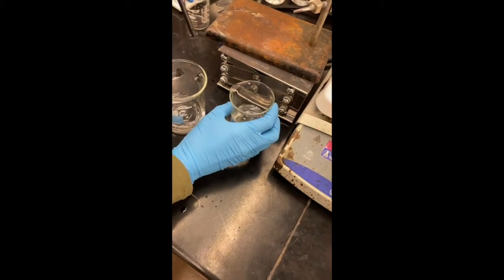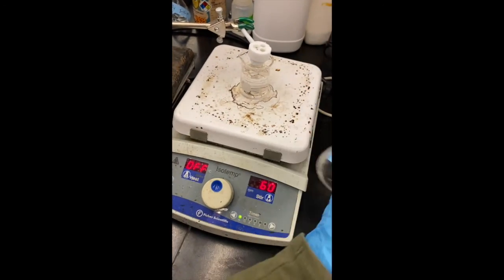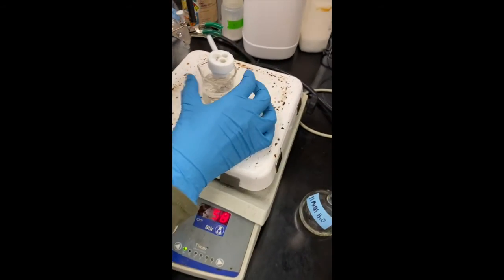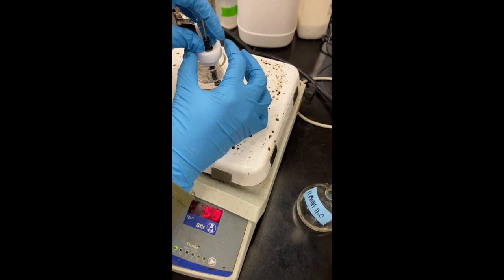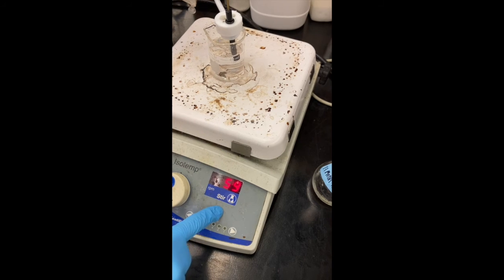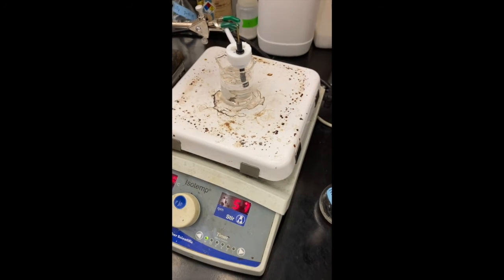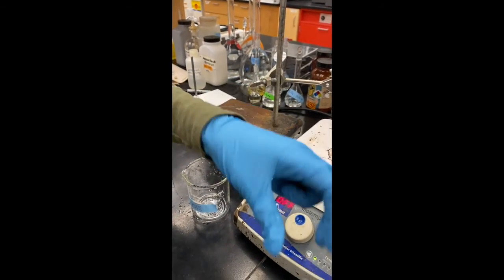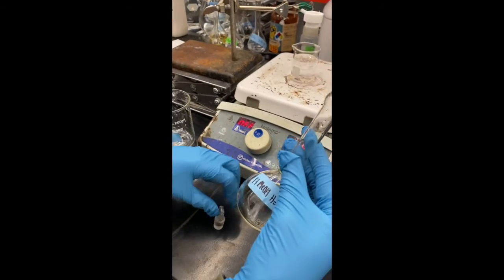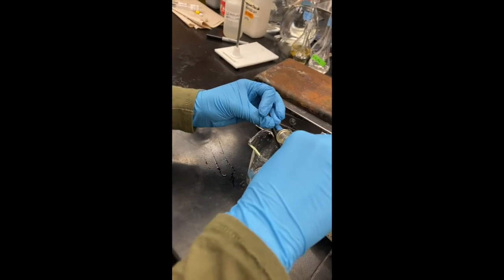And then from there, I have here a solution of 1:1 methanol and water. And I have a stir rod in there. And we're just going to soak it in this solution for about 10 minutes. And I have the stir bar at a rate of about 60 rotations per minute. So 10 minutes are up. We're now going to rinse the electrode with that same 1:1 methanol water solution. Just like this.